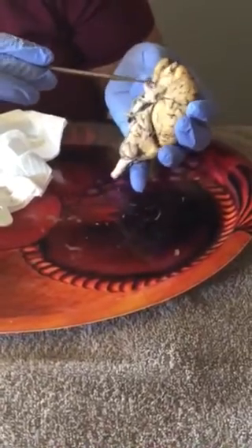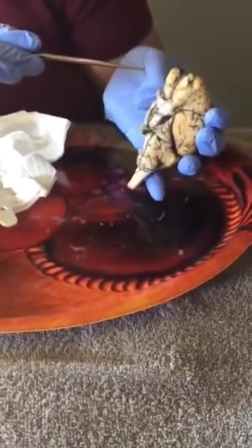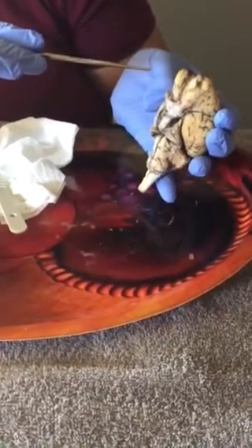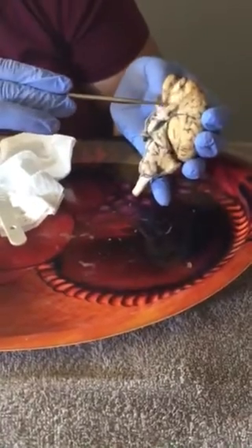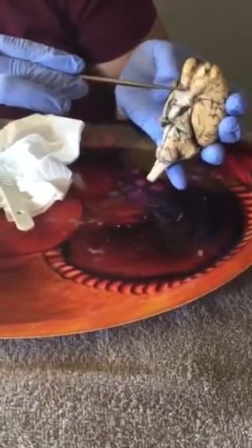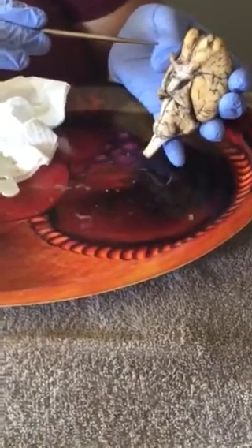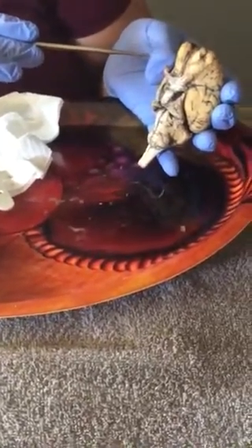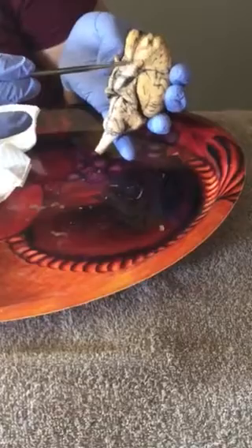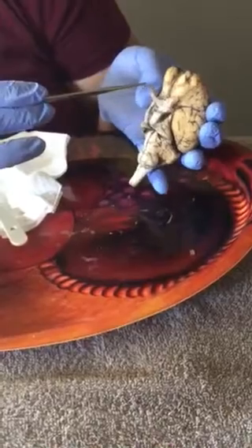The olfactory tracts are here. You can see them going along the way here. And then followed by the optic nerve. The optic nerve curves down into here. I think when I was dissecting this, it broke off a little, but this is the optic nerve. And then we also have the optic chiasm. The optic chiasm is this part here of the optic nerve, because these connect to the eye. And then the middle part here is the optic chiasm.